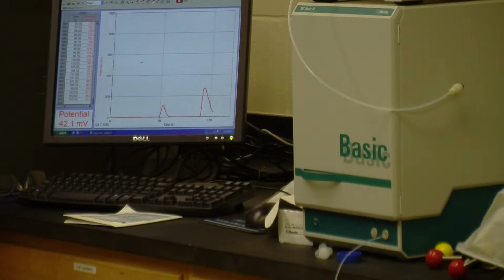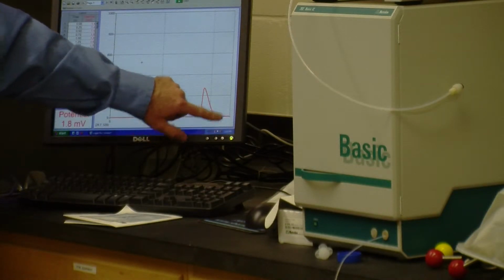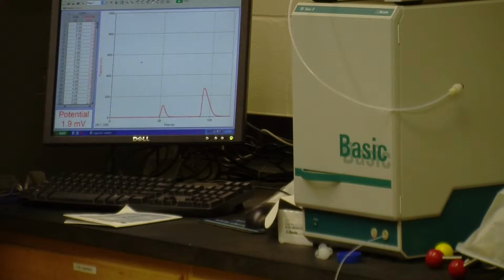It may be more than two substances, depending on the sensitivity of our detector and what exactly our column is made up of. This particular column, it turns out, absorbs certain gases like carbon dioxide, but it lets nitrogen and oxygen pass right through. This peak is the oxygen. This peak is the nitrogen. And so air is a mixture, a homogeneous mixture of two different substances, nitrogen and oxygen.